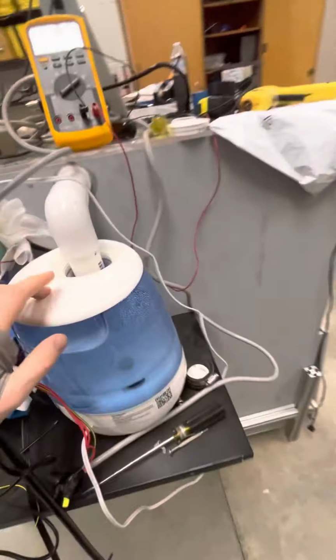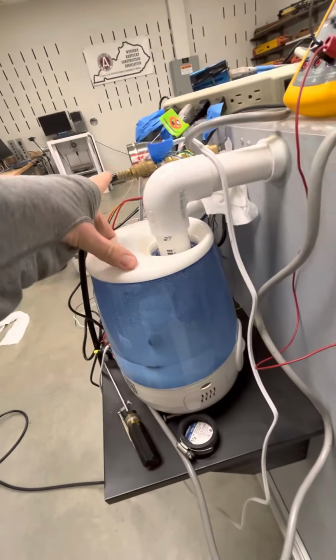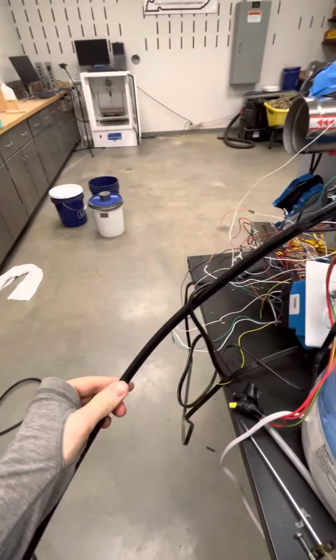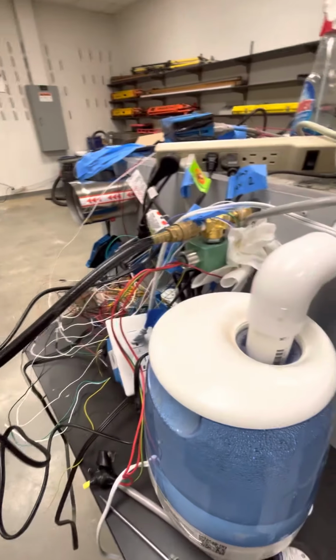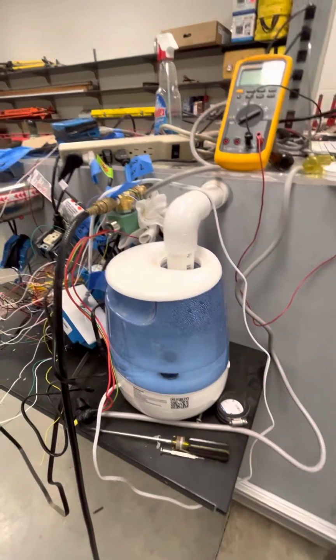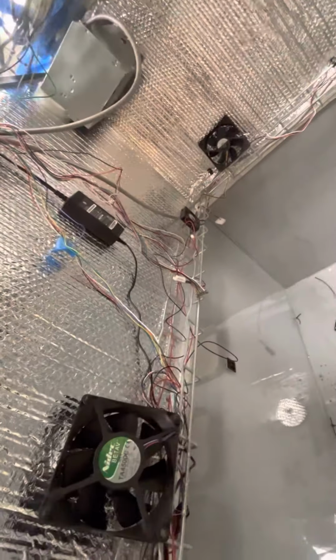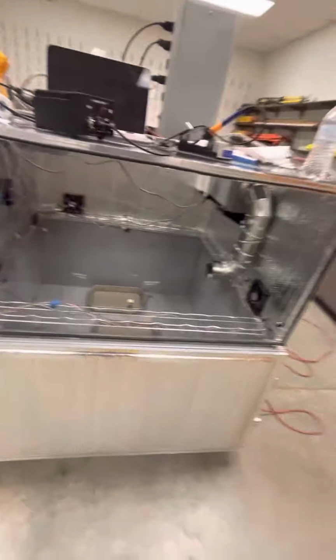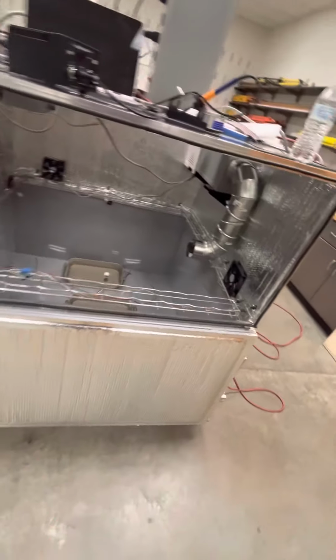Whenever we manage humidity, this is for if it's below the set percentage of humidity, and this is if it's above, it's just dry air coming in from a pressure system inside the building. And we also have a barometric sensor inside of it to make sure that the pressure inside the system that's coming from that pressurization system inside the building, from the compressor, never exceeds a certain percentage. I put it as just 1 psi.